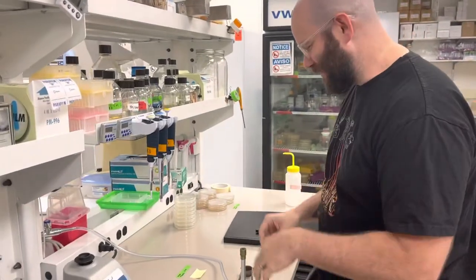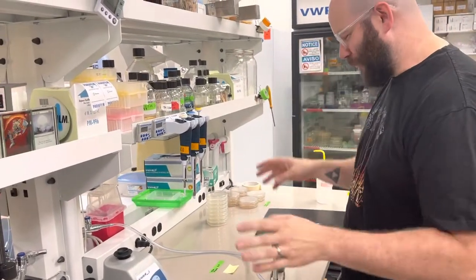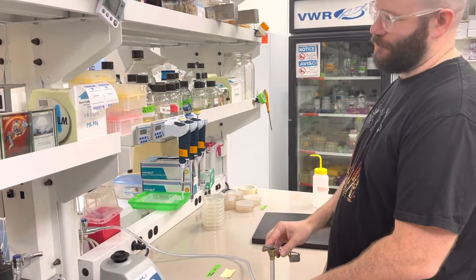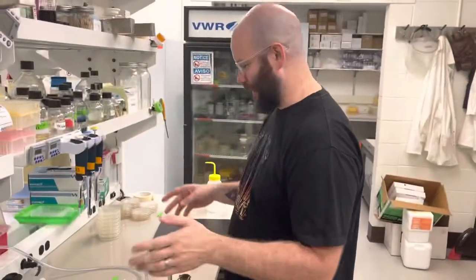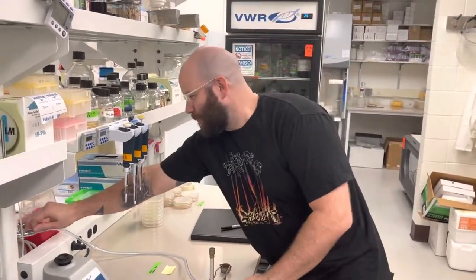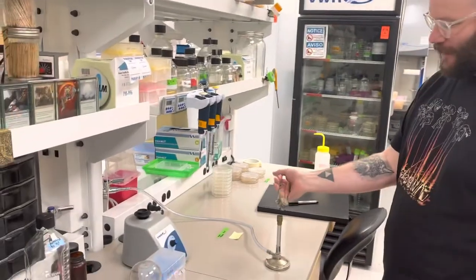I've seen this frequently in other labs and in my lab. People come to the bunsen burner and they try to strike it and it doesn't work.